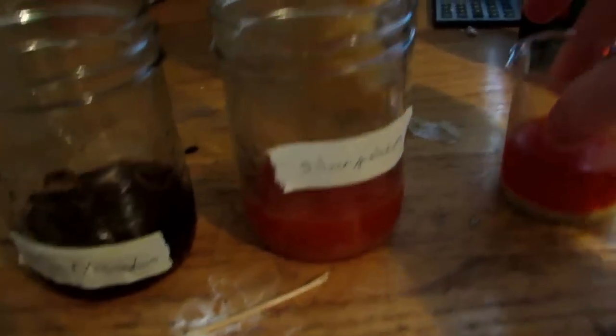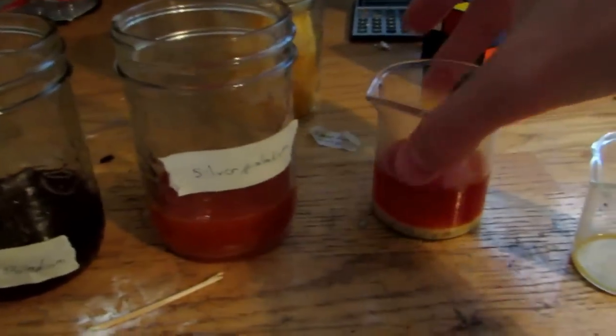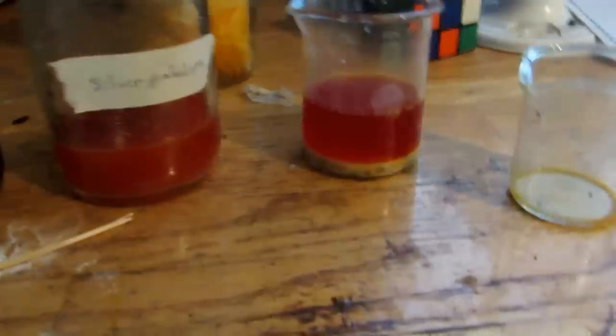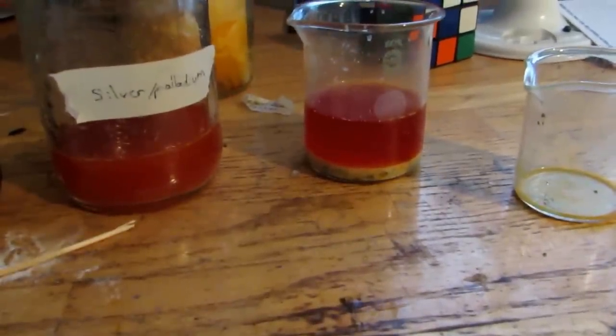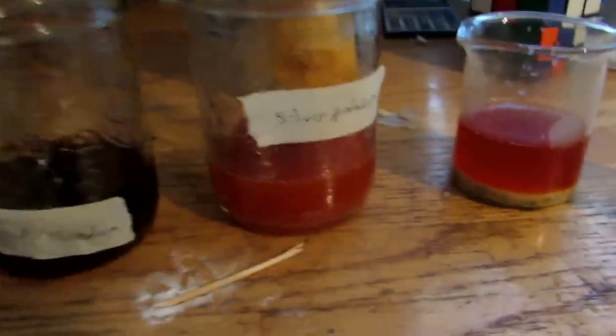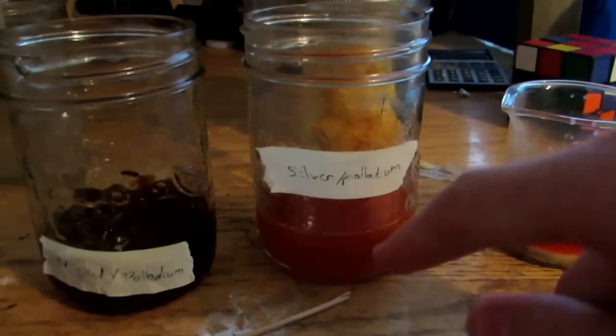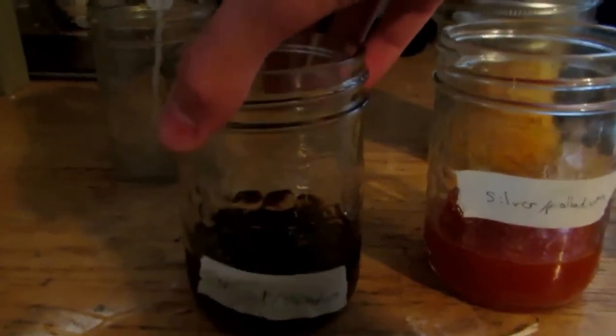Okay, so I have our solutions. You can see the one that was dissolving has turned quite dark now, so you can see a lot did dissolve. But, I'm still going to leave it to make sure that everything from those capacitors did indeed dissolve. I don't know if you can see, there's still teeny bubbles that are rising. The camera doesn't pick it up very well, but I can see it and faintly hear it. So, here's our silver palladium one, and then here's our nickel palladium solution.